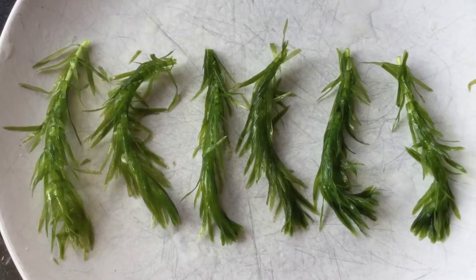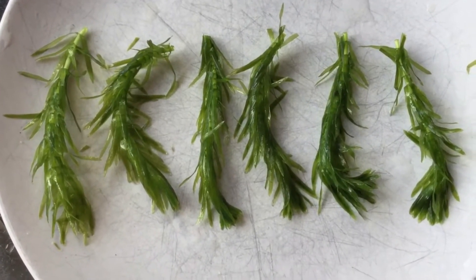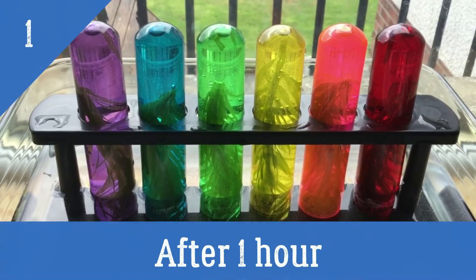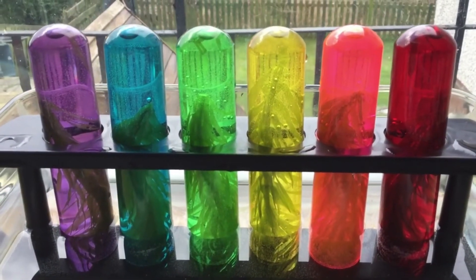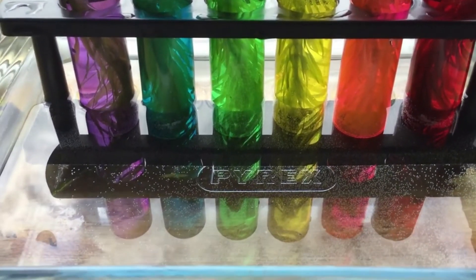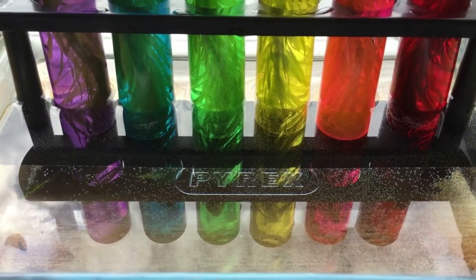I've cut six equal sized pieces of the Elodea pondweed. Next thing is to put them in the test tubes. I've added sodium bicarbonate and I'm stirring it around just to mix it through the water. They're all in the same water, so they have the same temperature of water and the same concentration of carbon dioxide in the water.